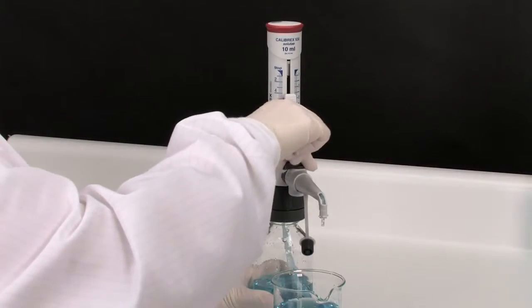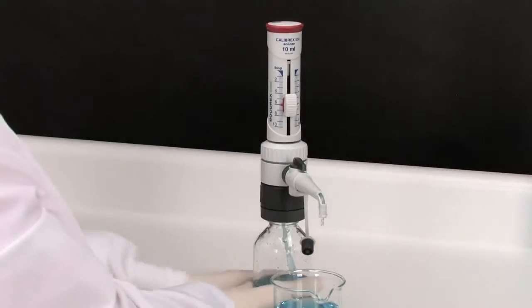When priming is completed, turn the stopcock to the dispensing position to start distribution.